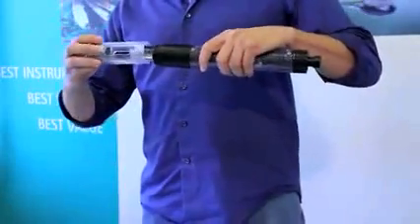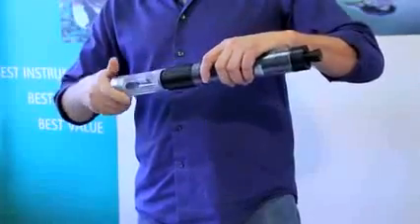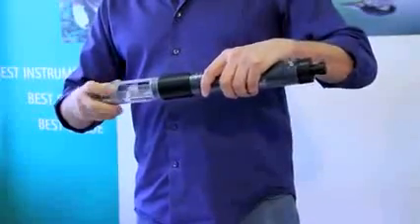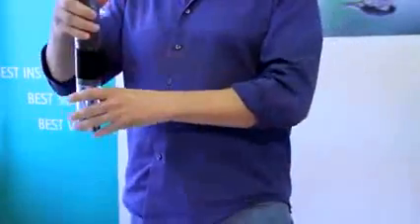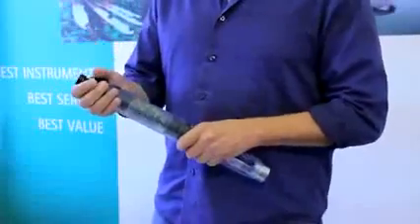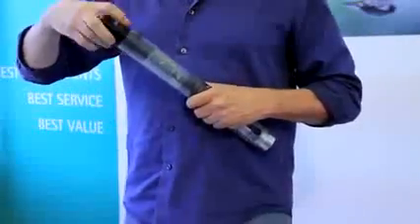And what I'm going to go ahead and do is put on the weighted sensor guard, which is what I would use if I was deploying this in the field. This helps protect the sensor. It also gives it the extra weight to lower it down. I will remove the plug.